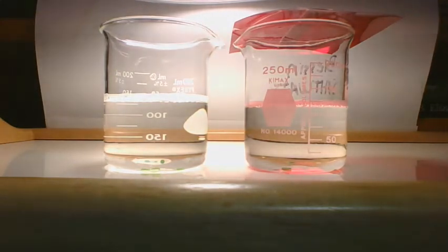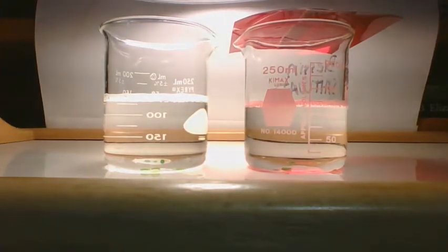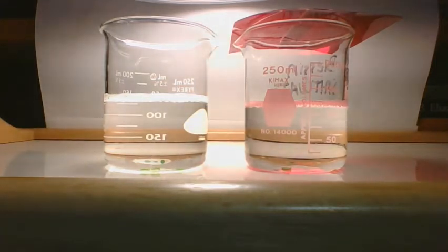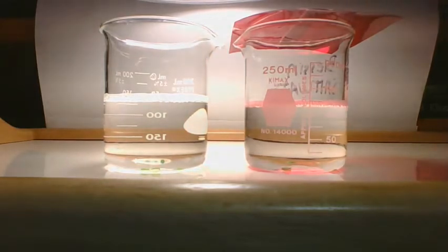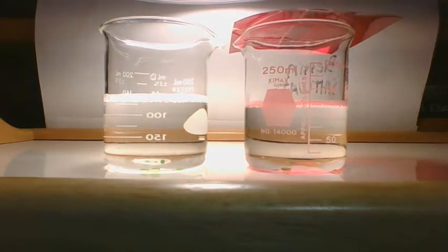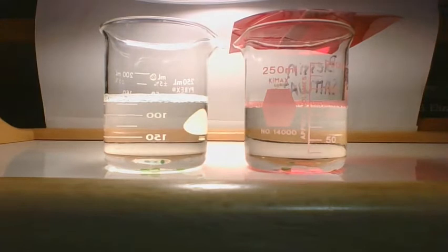Okay, hopefully you've made a decision and you looked at it and said, okay, this one's going to be faster than this one, or you have some sort of way of determining which one you think is going to work better. But right now we are almost to 1 minute. So in your data table at the 1 minute mark, you need to write 0 for both of them. 0 for the red filter and 0 for regular white light, because none of them have risen up to the top yet.